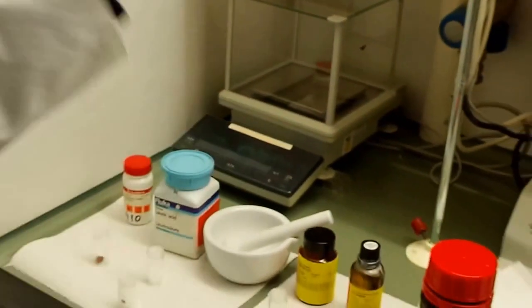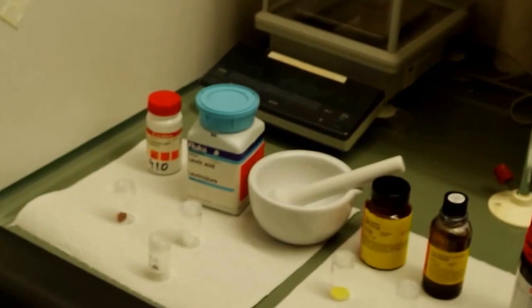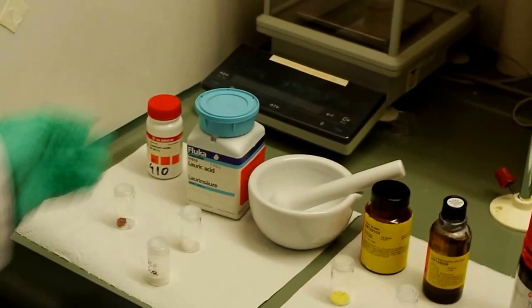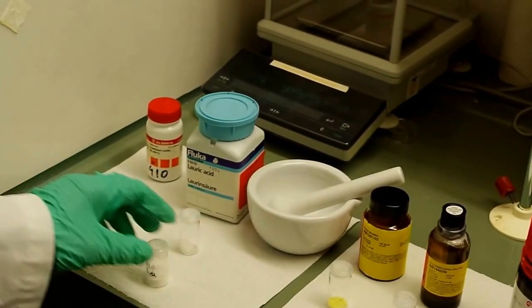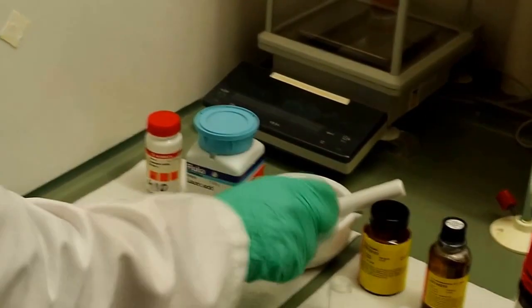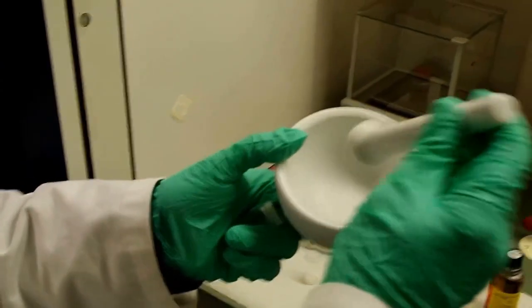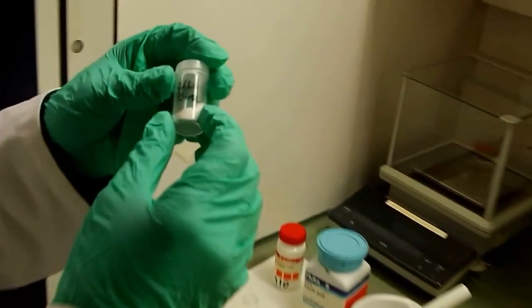If you mix these two things together, you should be very careful. You should do it under Schlenk conditions, and at about 200 degrees the cadmium oxide dissolves in lauric acid and you get a white solid stuff. This white solid stuff you take out and you pulverize it with a mortar. Alright, and then we have our precursor, which is a white powder. Cadmium laurate, it's called.